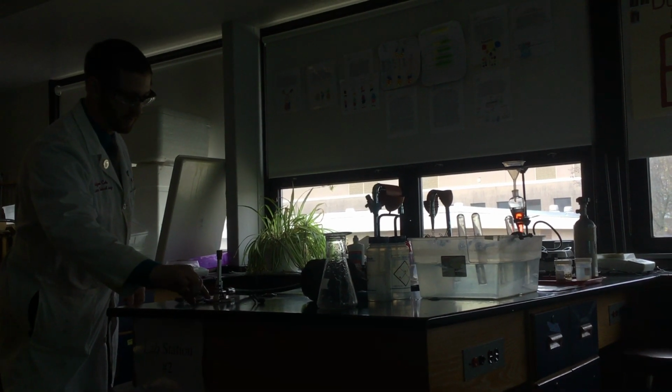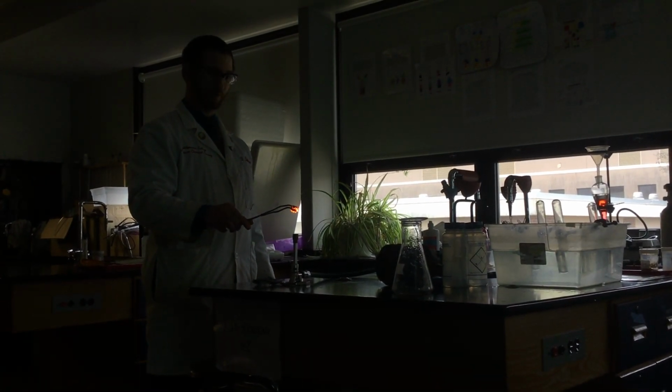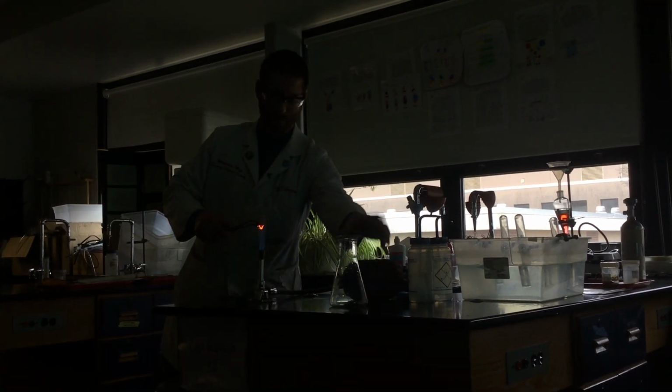All right, so here goes nothing. Let me go ahead. I'm just going to put this on to keep the oxygen in there. I definitely want to start out with some hot steel wool. And then we'll see if it reacts any faster in the presence of our oxygen. So it's still glowing kind of red hot.